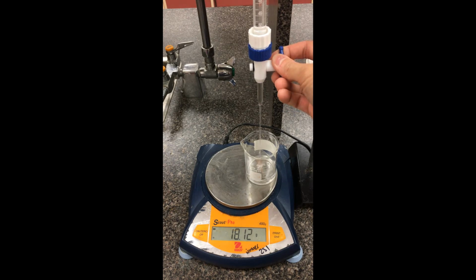So we're going to keep going here, down to the 21 mark, 21.04. We have that mass. We're going to go down to about 24. So yeah, that's almost spot on, 24.00. Mass is 23.92. We're going to go down to the 27 mark here, so 27.10. We have the mass 27.07.